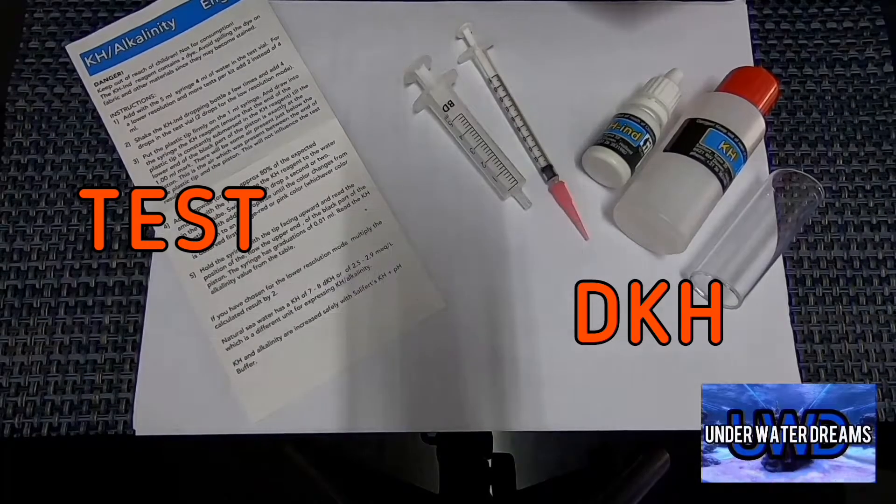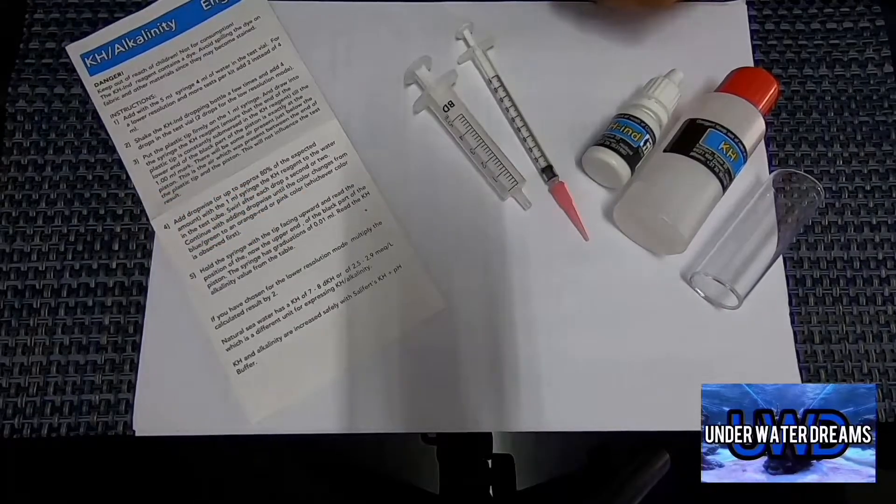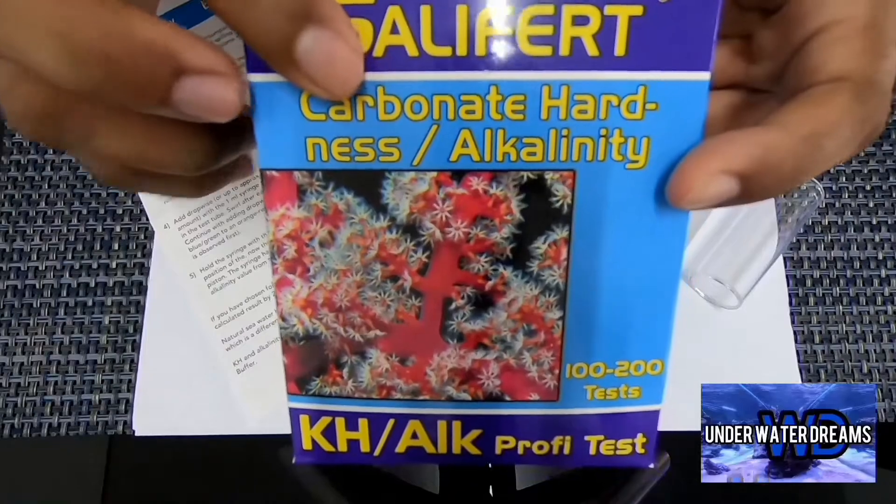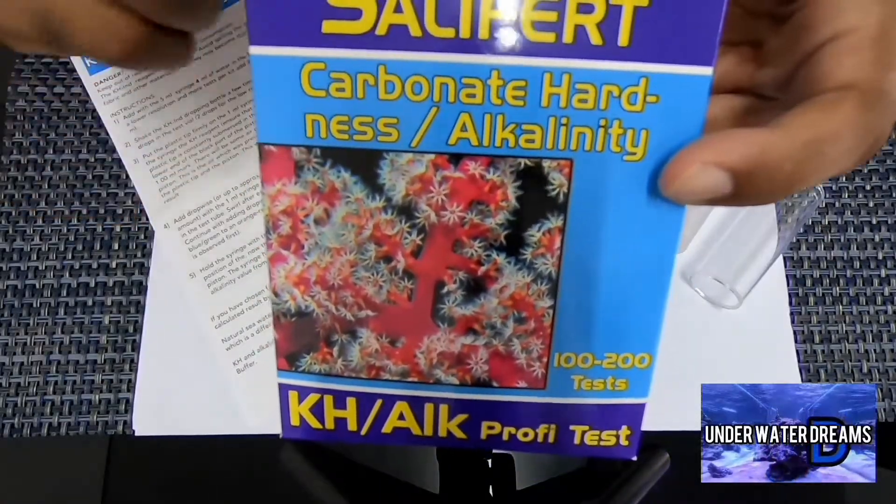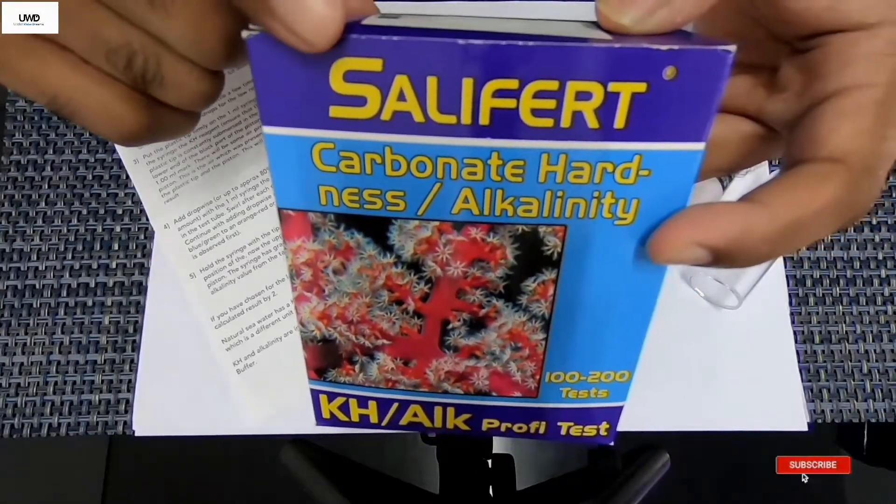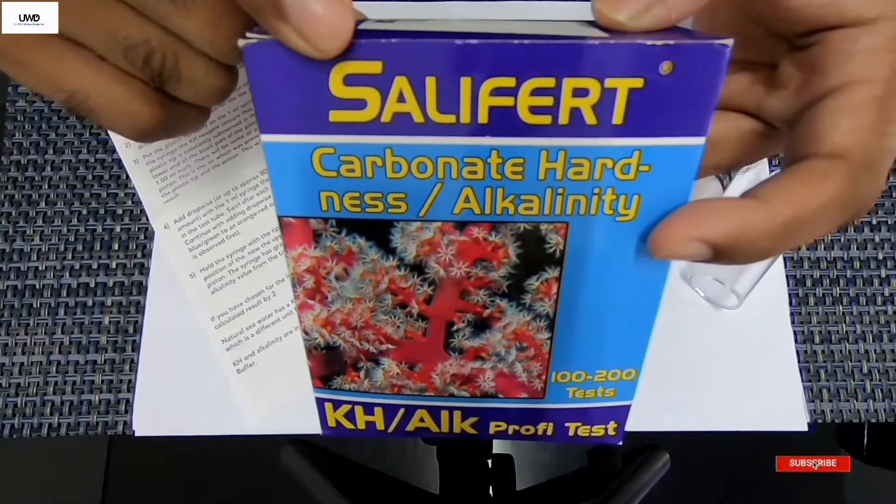Welcome back to Underwater Dreams. Today I'm going to be showing you guys how to test your carbonate hardness or your alkalinity, or better known as dKH in your reef tank using a Salifert test kit.